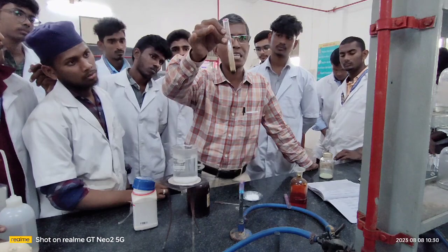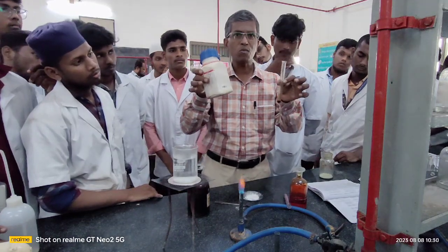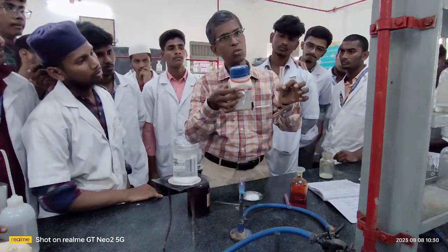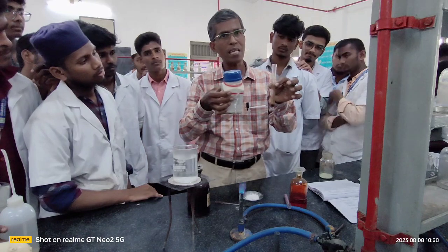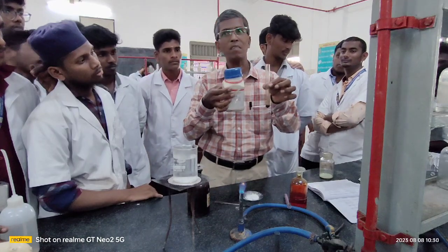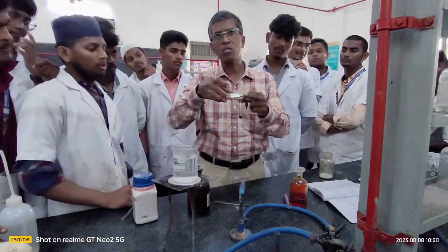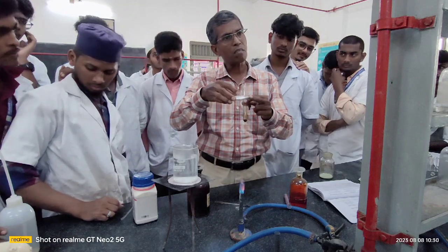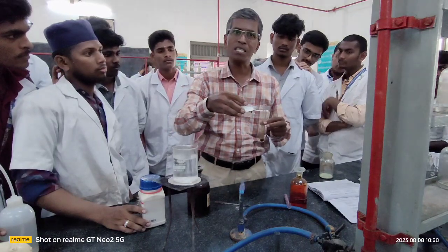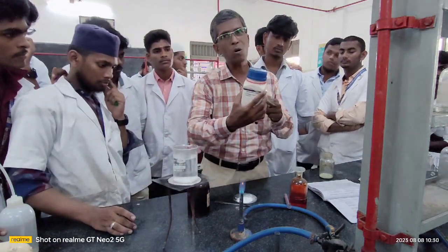The original color of potassium permanganate has disappeared because the organic compound that I used to carry out this analysis is cinnamic acid, which is an unsaturated compound. C6H5CH=CHCOOH, a monocarboxylic unsaturated aromatic acid, is nothing but cinnamic acid. Whereas the previous one that I used to confirm the presence of an aromatic compound is saturated. For that I used phthalic acid. Phthalic acid is a saturated dicarboxylic acid, whereas cinnamic acid is an unsaturated monocarboxylic acid.